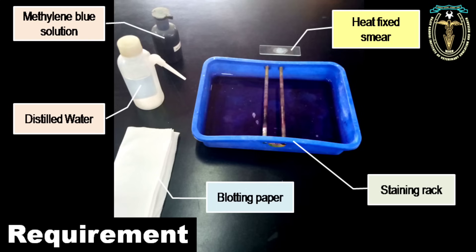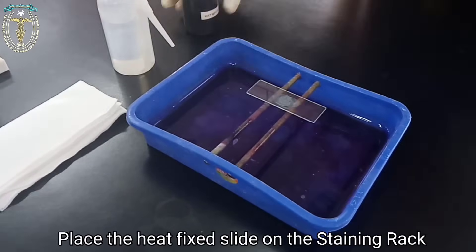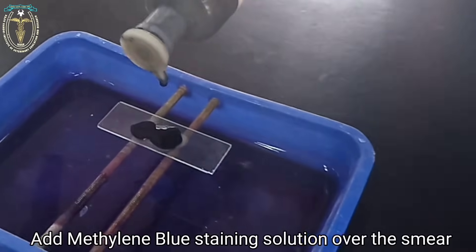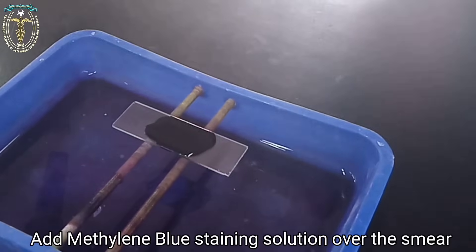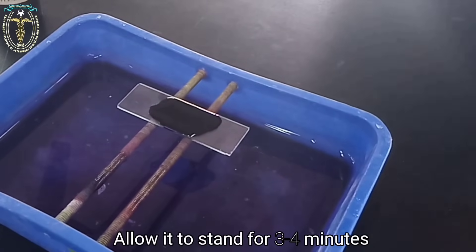These are the requirements for conducting the simple staining procedure. After the preparation of the smear, place the fixed smear on the staining rack. Add the methylene blue staining solution over the smear, covering the entire smear with the staining solution, and allow it to stand for three to four minutes.